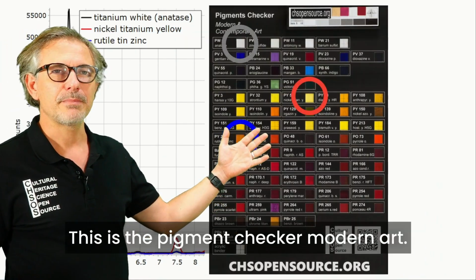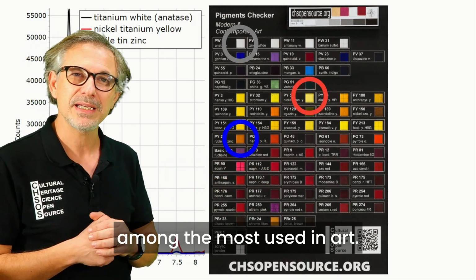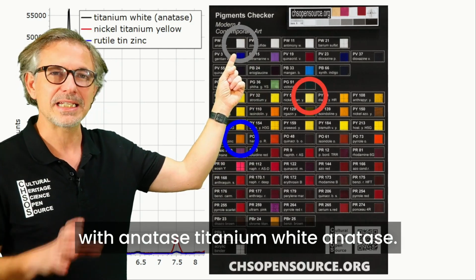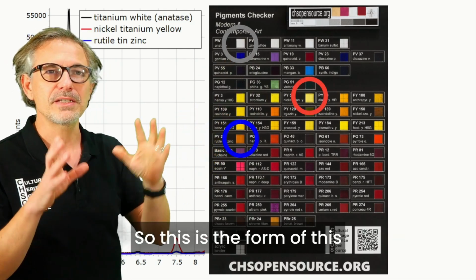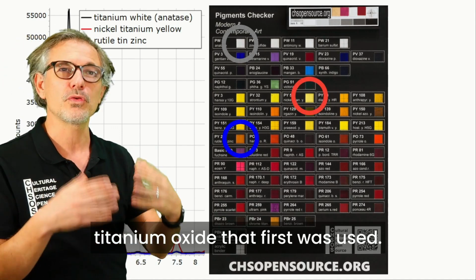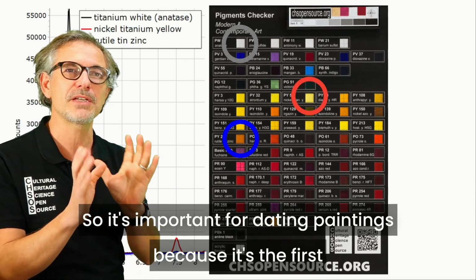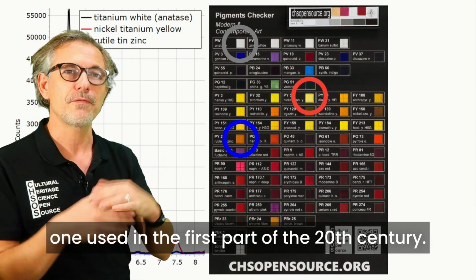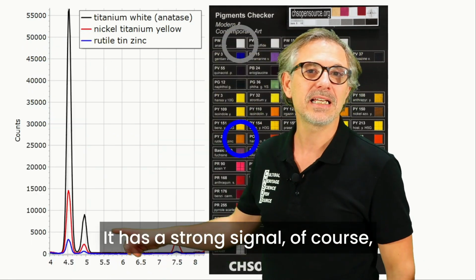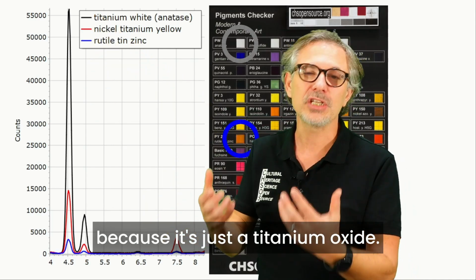This is the pigment checker modern art, the collection of modern contemporary pigments among the most used in art. First of all, we start with anatase, titanium white anatase. This is the form of titanium oxide that was used first, so it's important for dating paintings, because it's the first one used in the first part of the 20th century. It has a strong signal, of course, because it's just a titanium oxide.